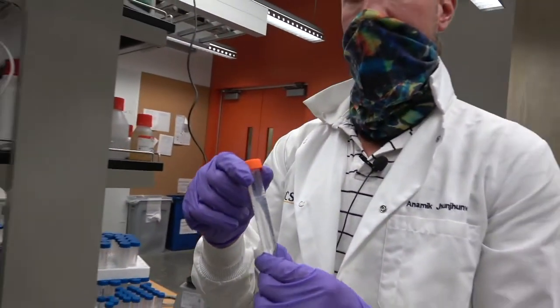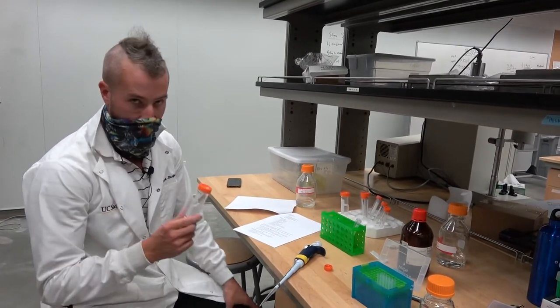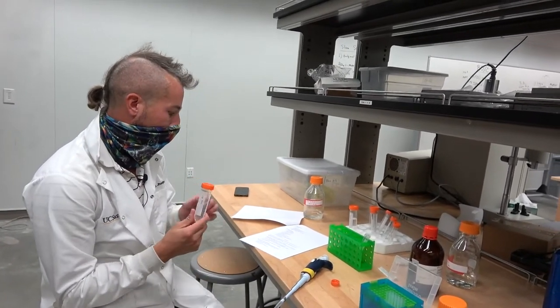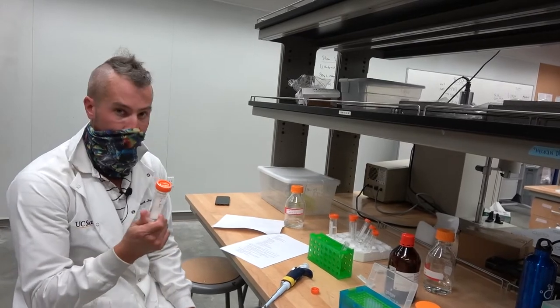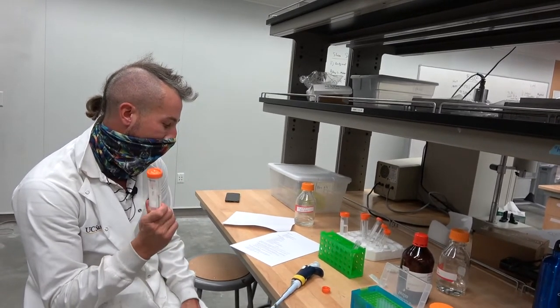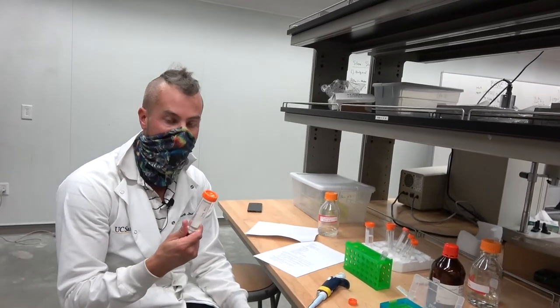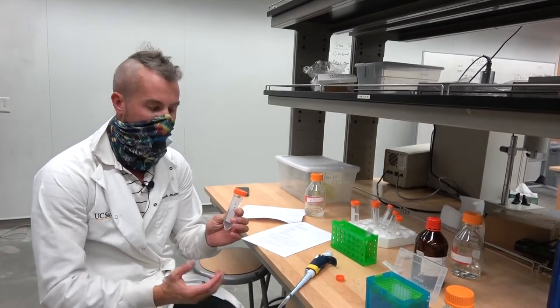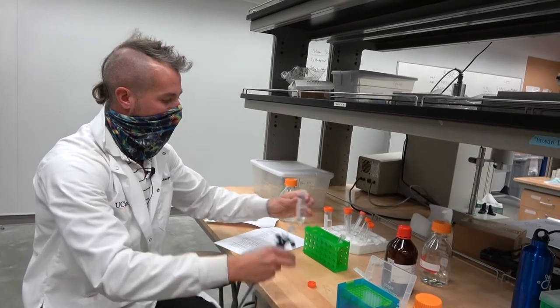Now we're on to part two where we are going to prepare most of the particles that we're going to use for imaging. I have a 50 mL tube. I've added 21 mLs of water and 3 mLs of PBS. Then on step 2C, I've added 3 mLs of PEI. As you recall from the lecture, PEI is polyethylenimine, and that is our base that's going to catalyze this sol-gel reaction. The very next step is adding in the silica, the hydrolyzed TMOS, 6 mLs of that.